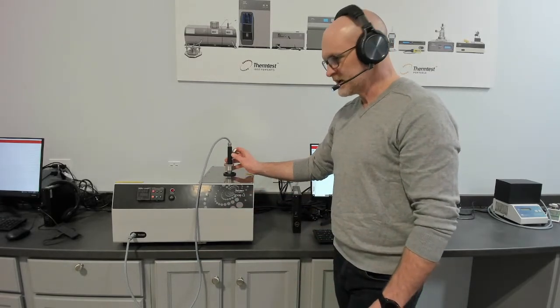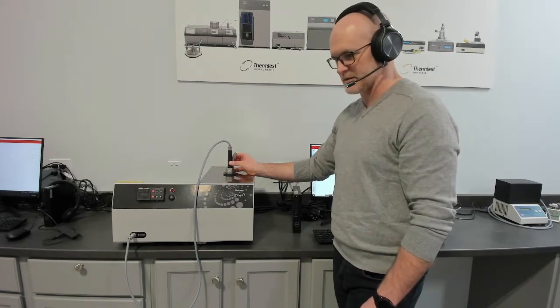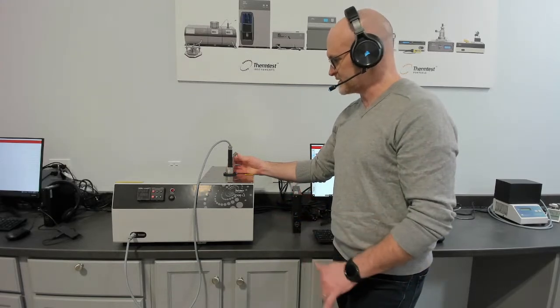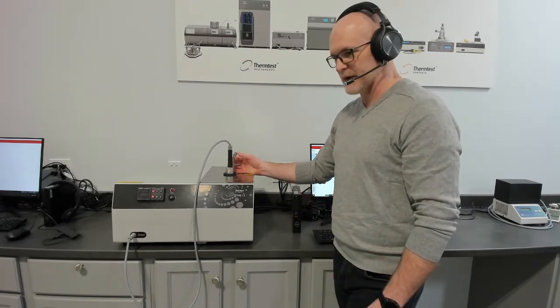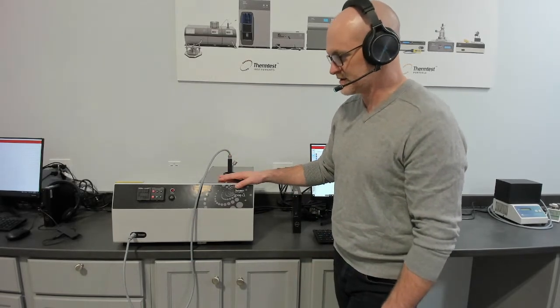The sensor is designed specifically to limit the effects of convection, which is the enemy when you're measuring fluids. To also be able to measure a wide viscosity range and test past boiling points, you can back pressure the sensor up to 20 bar and 35 bar. So that's the Transient hot wire.